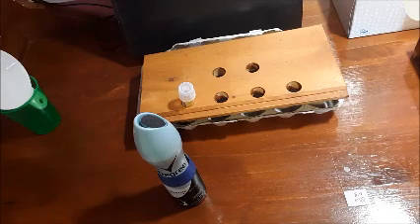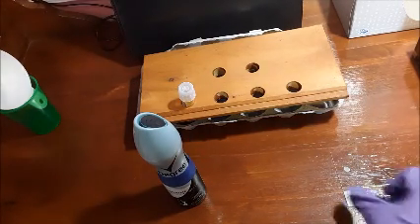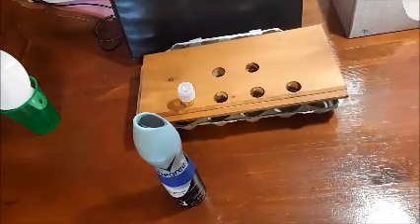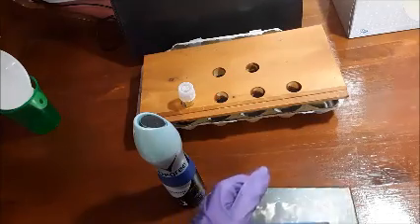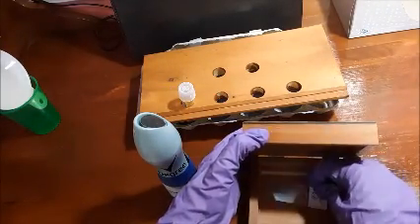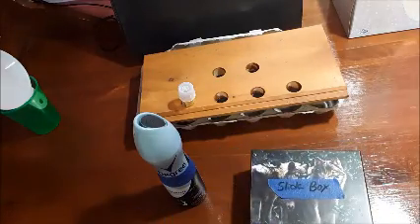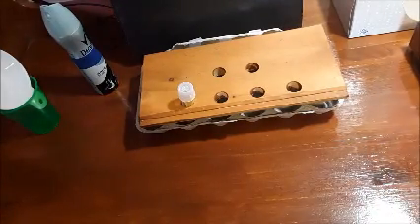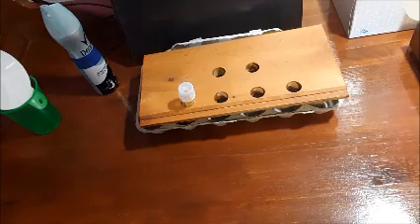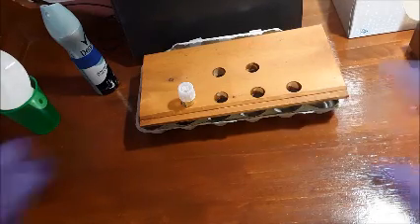So just remember that. And when you're done heat fixing your second slide, along with your first slide, you're going to put your slide, I know this isn't a real slide box, but if it were, you would take your slide and put it in the slide box for safekeeping. Once your slide's been put away in a safe place, you would then disinfect your workspace using germicide to, again, kill or inactivate any of the microbes that could be on this workbench.